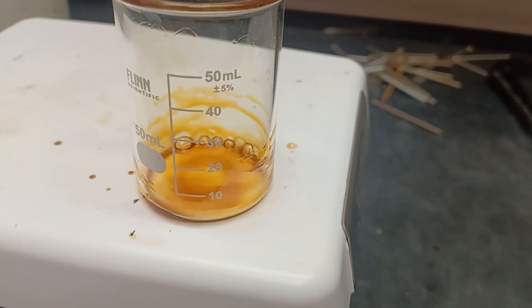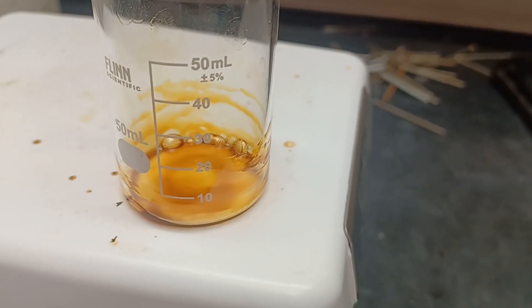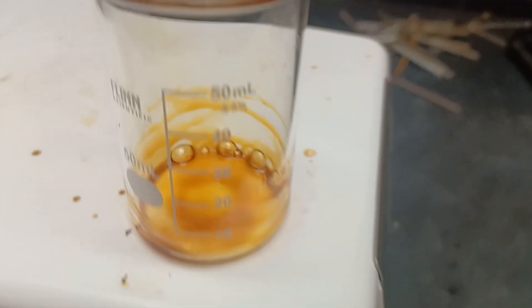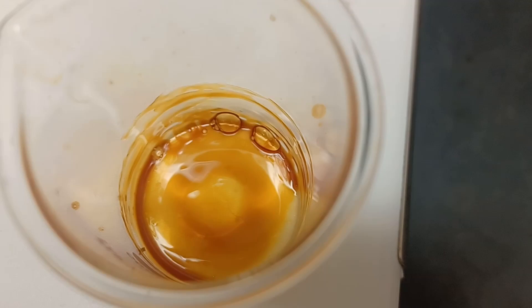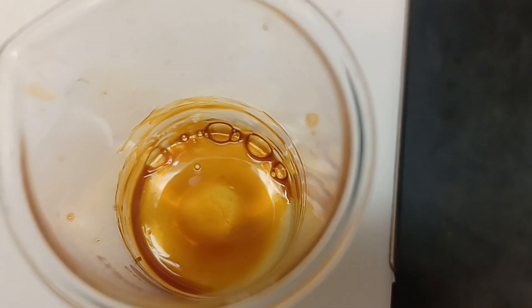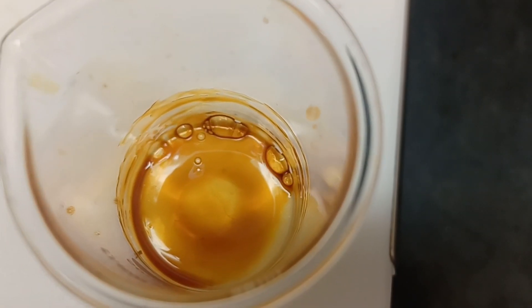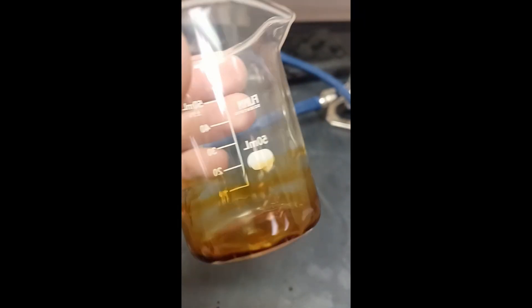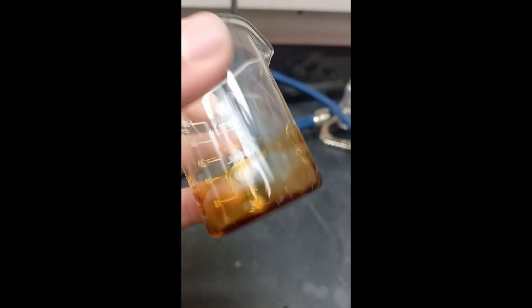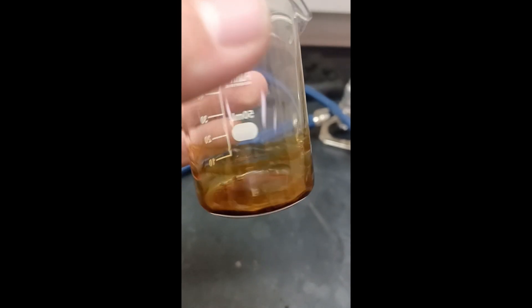The solution collected in a vial is then heated to evaporate all of the ethanol in order to remove low boiling point side products and calculate percent yield. A yield of 63% was calculated, which was quite good for this relatively unsophisticated method of synthesizing cadaverine.